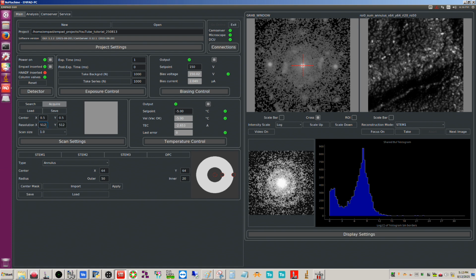Just for simplicity's sake, I'll do 256 by 128, and you can see whichever one of these is the larger, it's going to expand to the full frame, okay? So if I go 128, it's going to go full now, okay? So hopefully that makes sense. Let me go 256 like that.